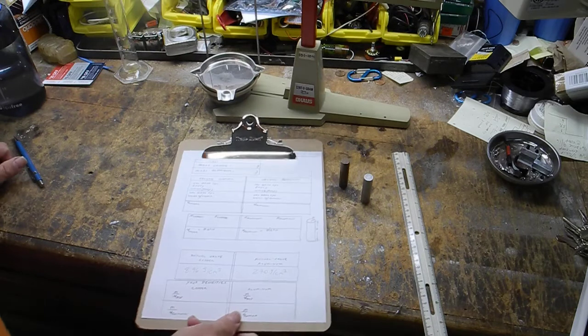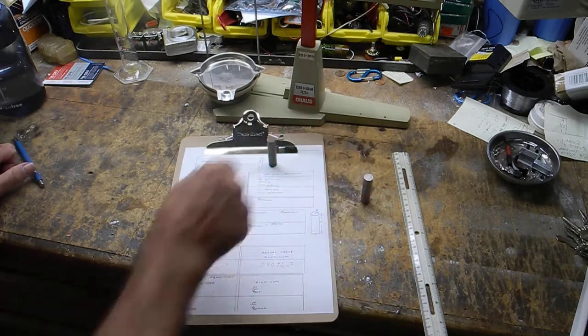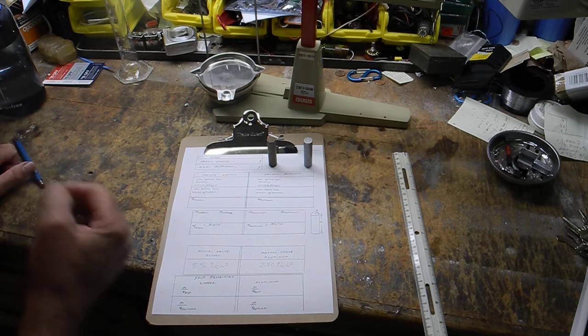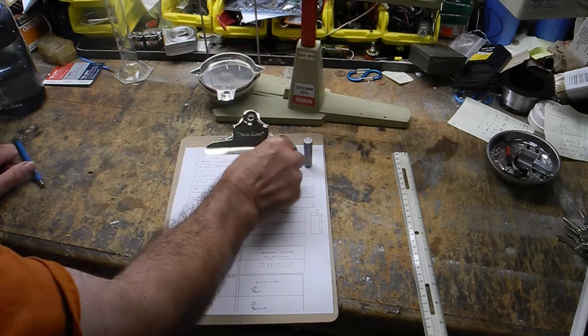We're going to find four densities. We have two objects but four densities, and the reason why is we're going to find two densities for copper, because we're going to use two different methods. Two densities for aluminum, because we're going to use two different methods. We're going to measure the mass just once, but we're going to measure the volume by two methods.